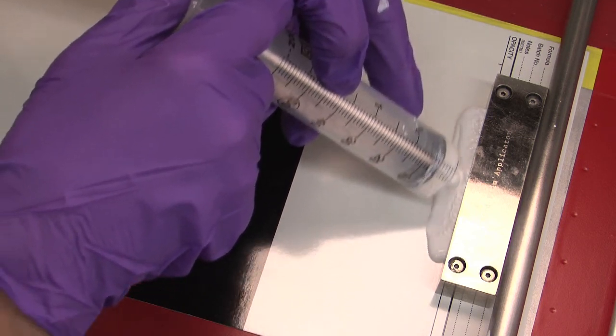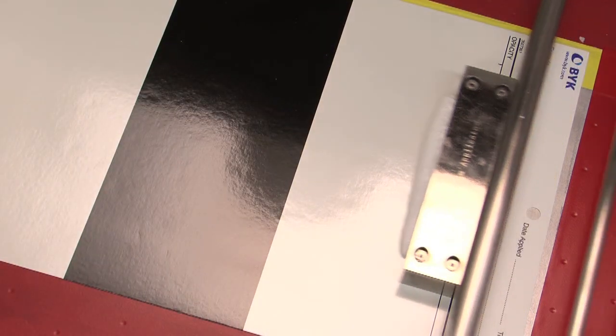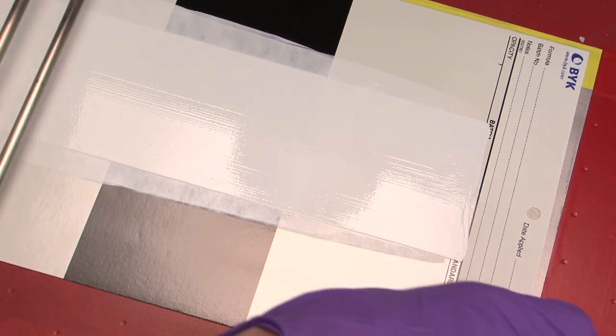To evaluate a paint's hiding power, we run an opacity drawdown and let the panel dry for one day.